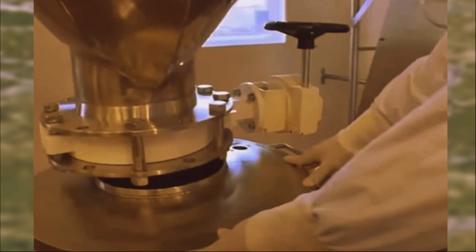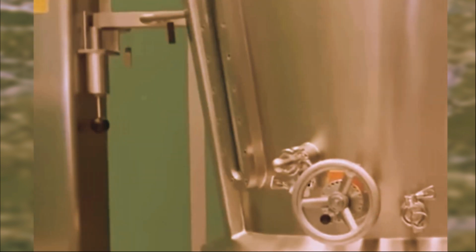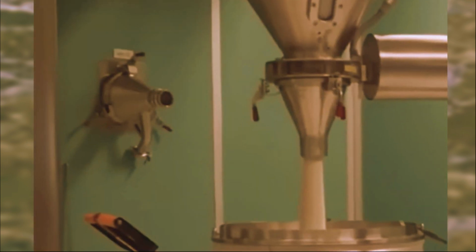The tablets or capsules are then, Step 9, packaging. Carefully packaged into blister packs, bottles and other containers to keep them safe. But this step is more than just putting pills in a box. Each package gets a label with details like the drug name, dosage and expiration date. Unique batch numbers are also printed to track the product.